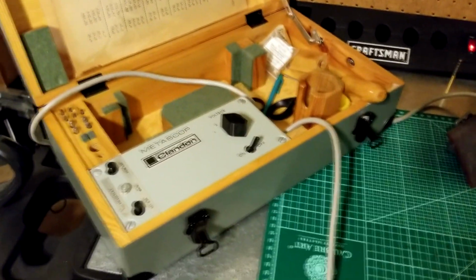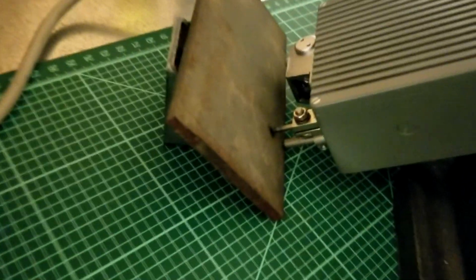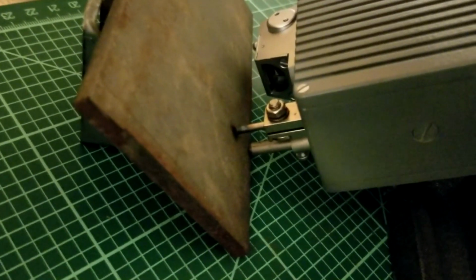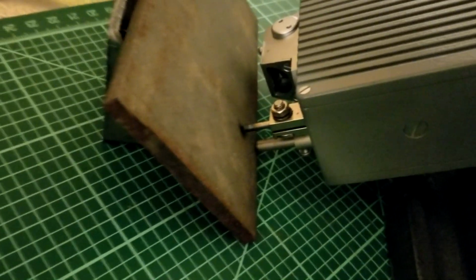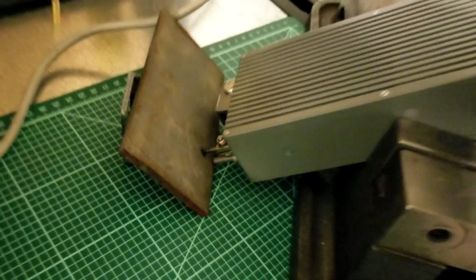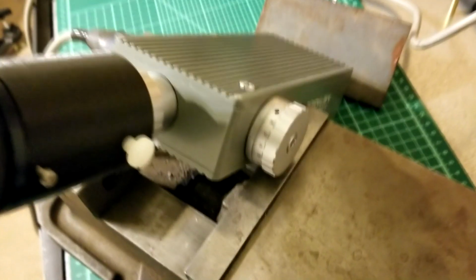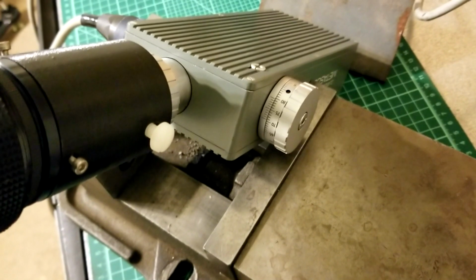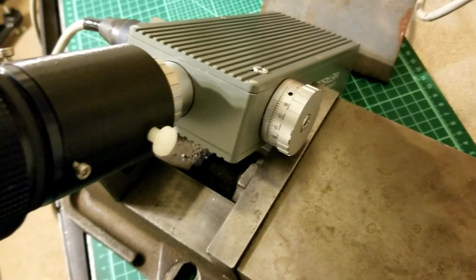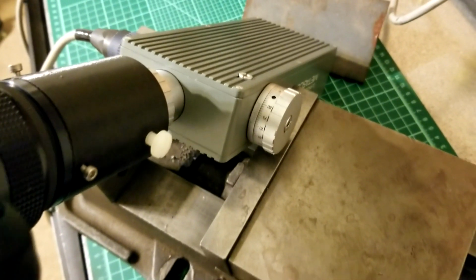So if I can show you what I'm trying to do here, I have a piece of carbon steel plate here that I'm going to strike an arc on, which vaporizes it, and it's supposed to read the spectra lines. There's a dial over here on the other side that I assume when I rotate it, it will show certain elements in the spectra.